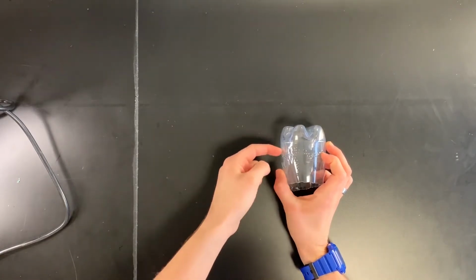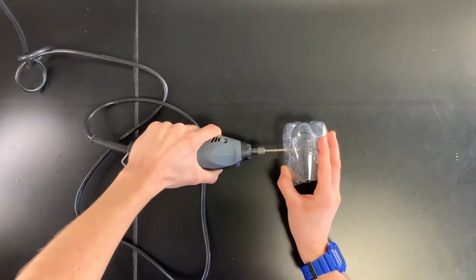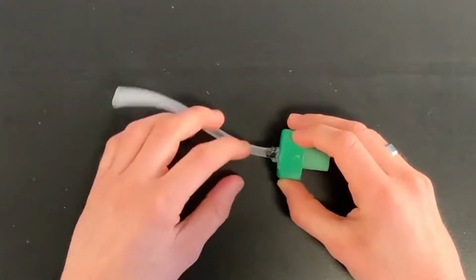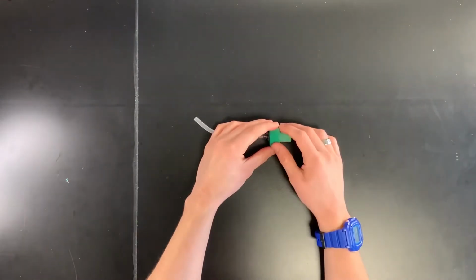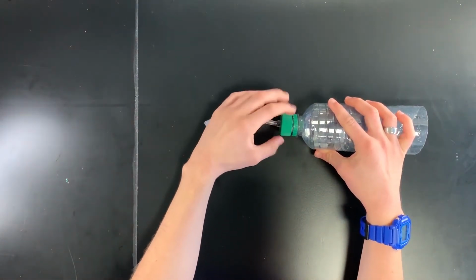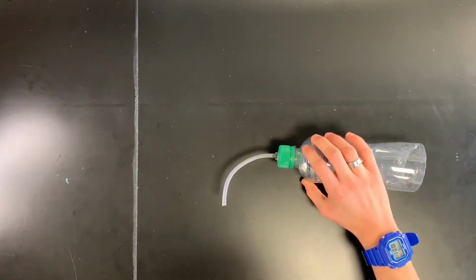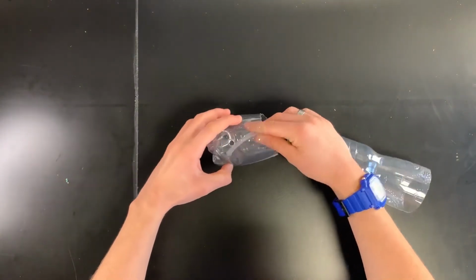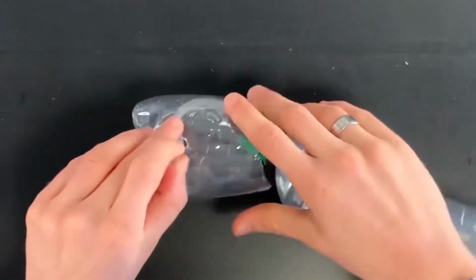Take the base of the hatchery and drill a hole into the side here. Now that we've let the silicone harden for 12 hours, it's time to start putting the hatchery together. So first, we take the main body of the hatchery and screw the bottle cap on like so. We take the base of the hatchery and we're going to feed our rubber tubing through the hole that we drilled earlier, like so.